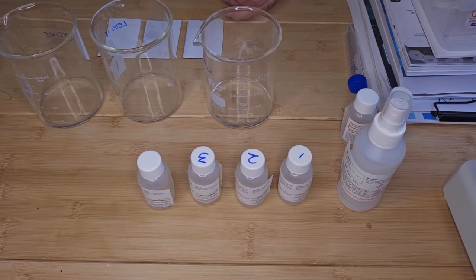So you want the solvent to be below your application line so that when it starts migrating up the plate, it takes the sample with it. If the solvent goes over the application line, the sample will just dissolve into the solvent, and that's not what you want.